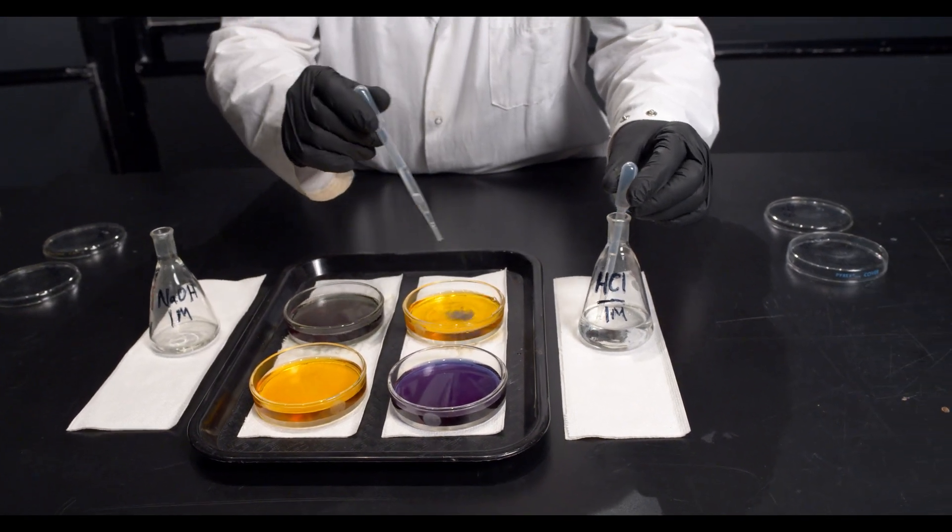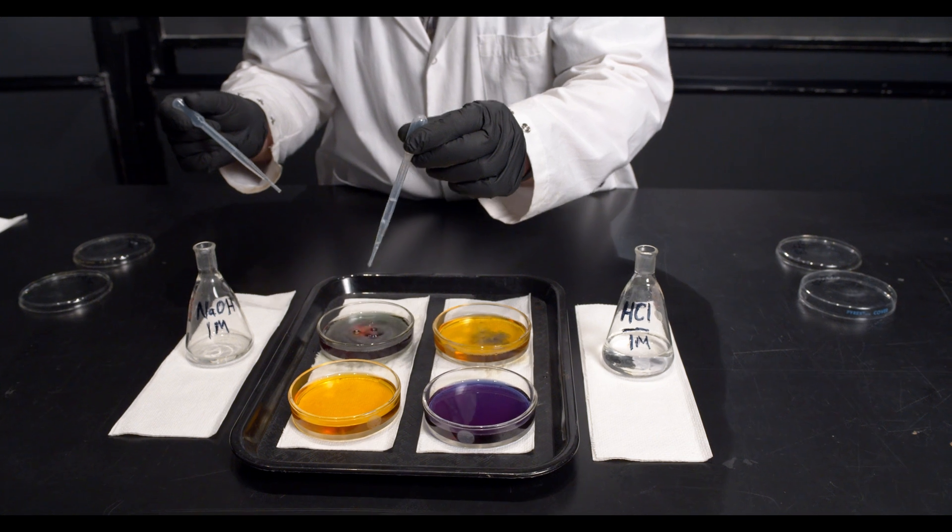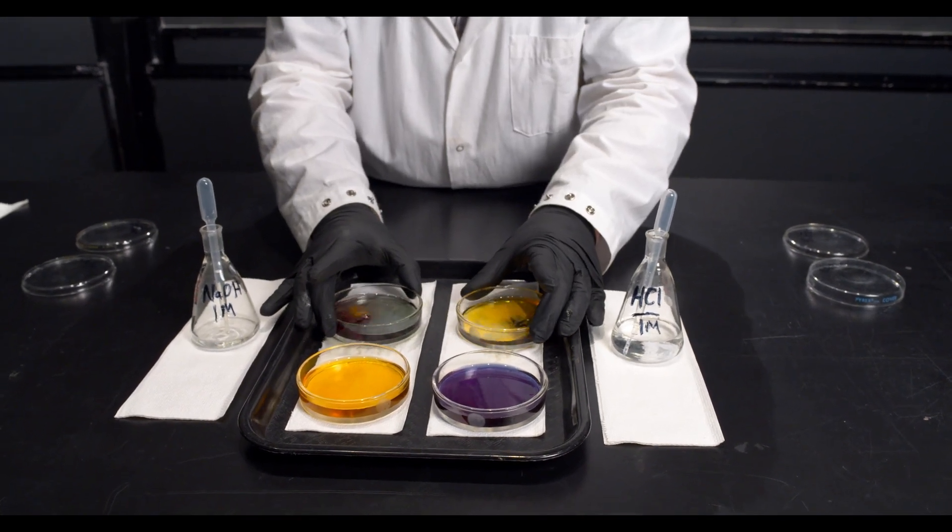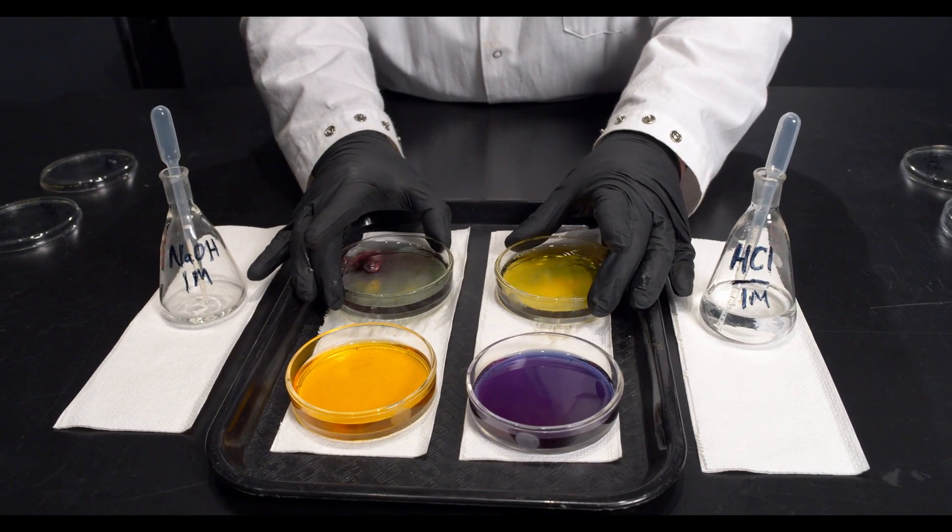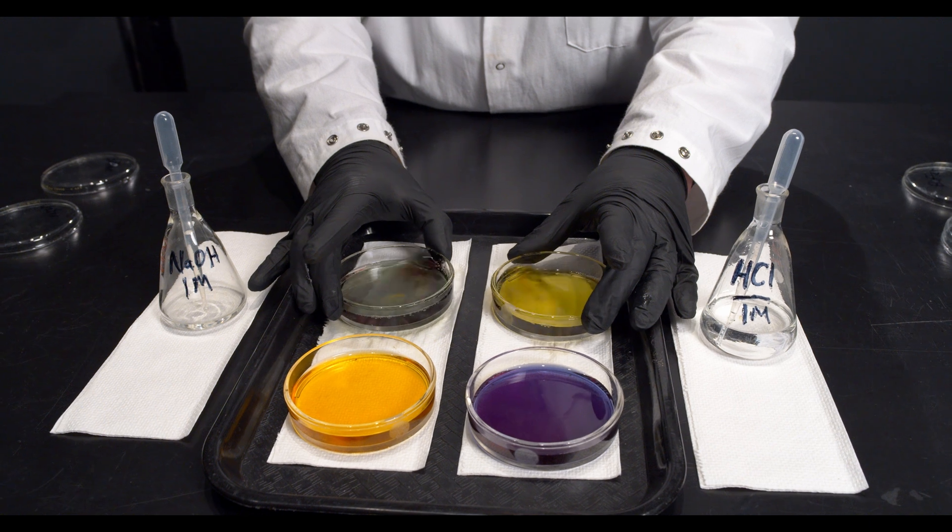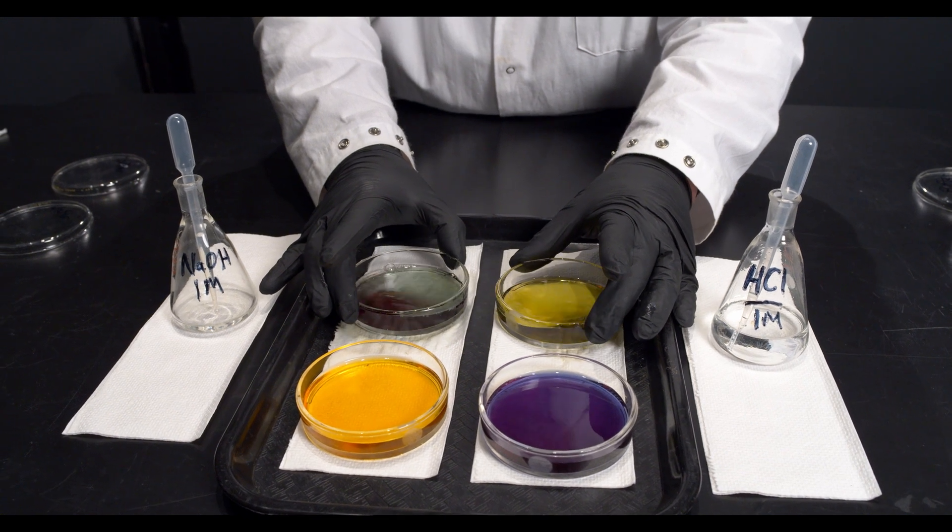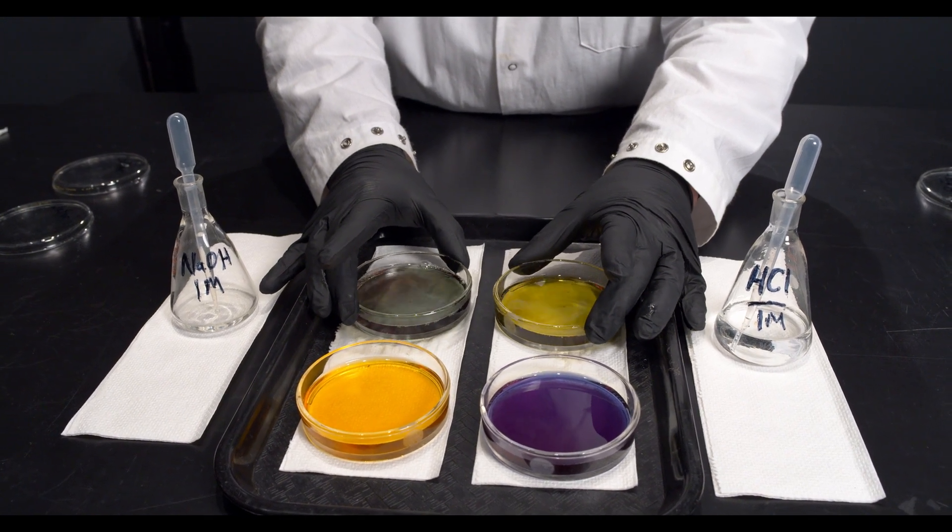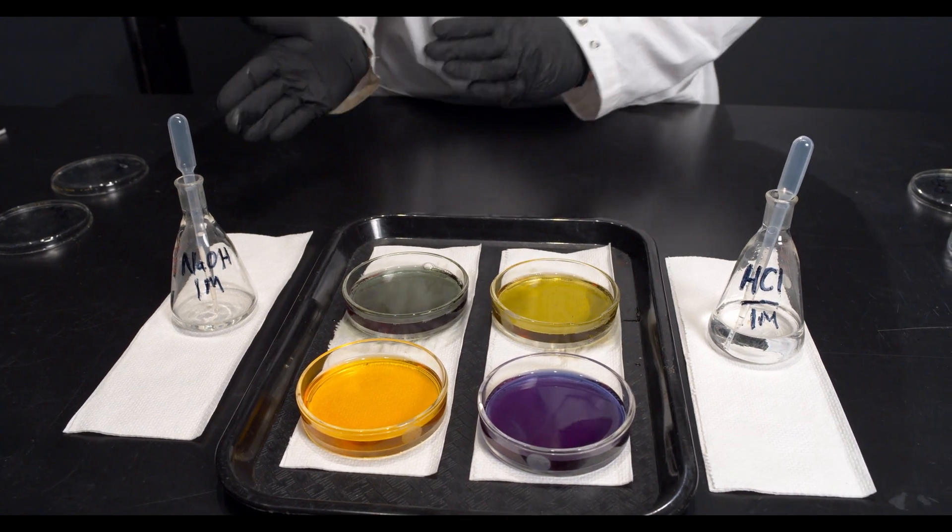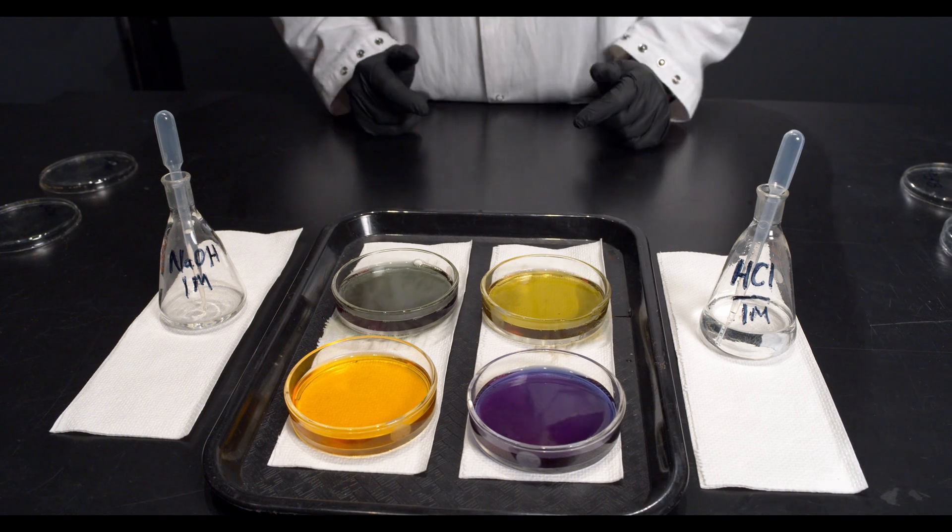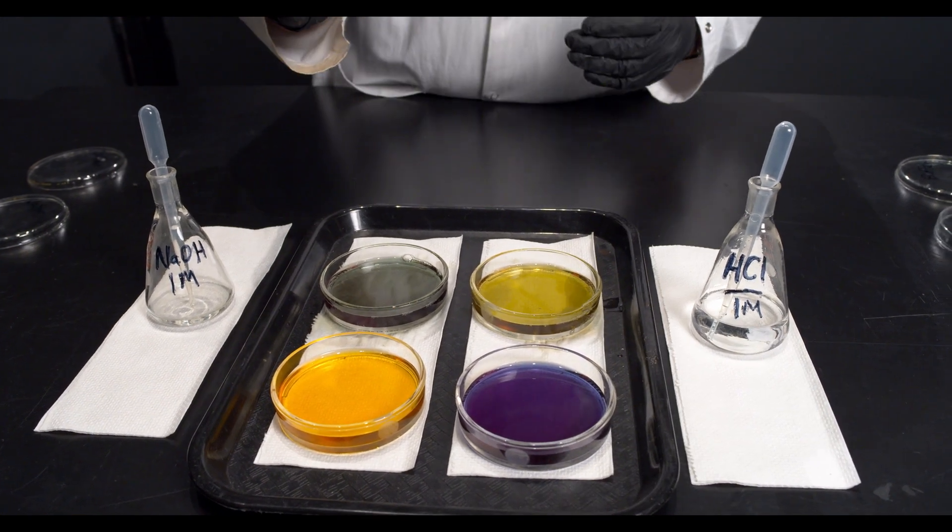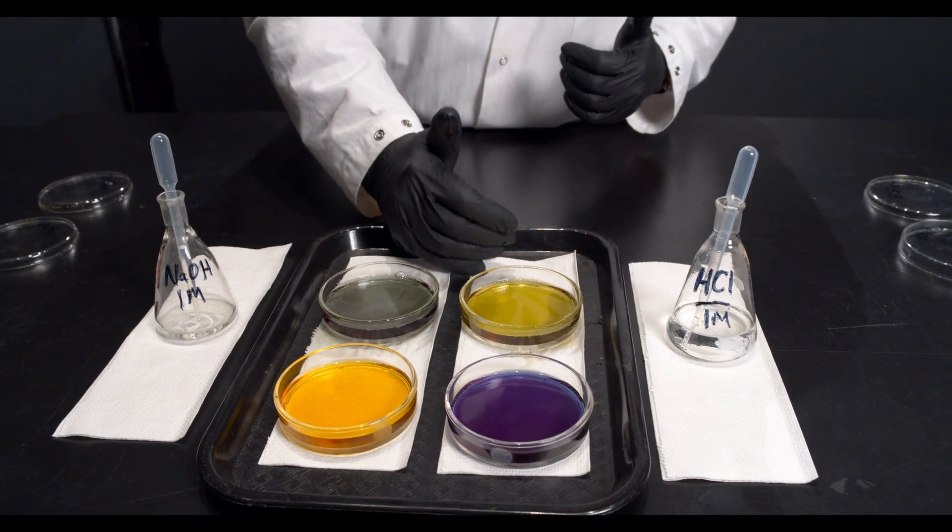However, if I add acid and base to the buffered solution, you can see that they're heading back towards neutral, but the pH doesn't change as much as with the pure water.